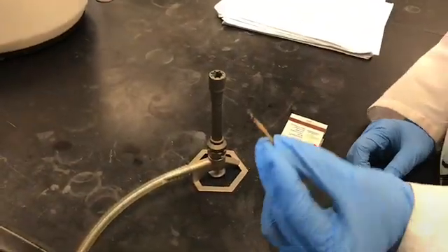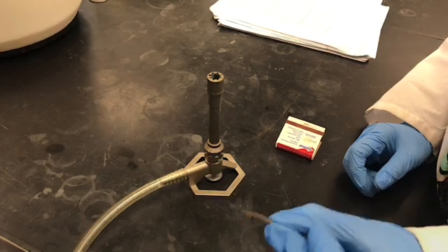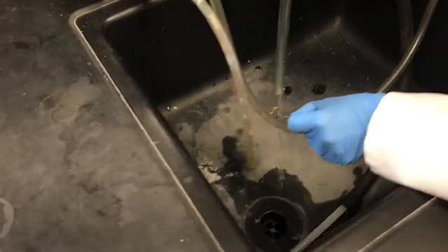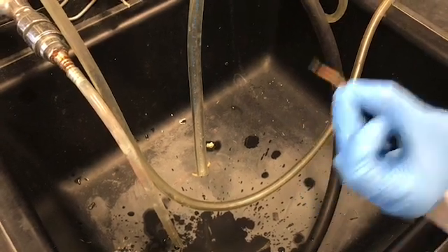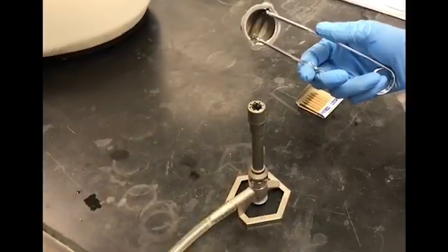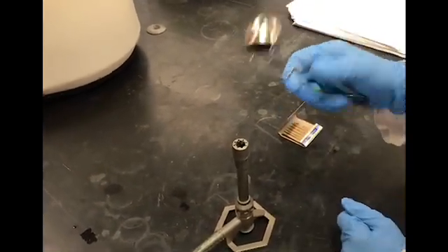I just lit the Bunsen burner with the matchstick. You cannot throw the matchstick into the sink — you must completely wet it with water so it is fully extinguished, then throw it in the trash. Alternatively, you can use a striker to light the flame, in which case you do not have to worry about extinguishing a matchstick.